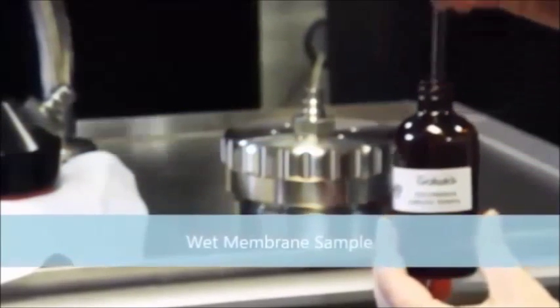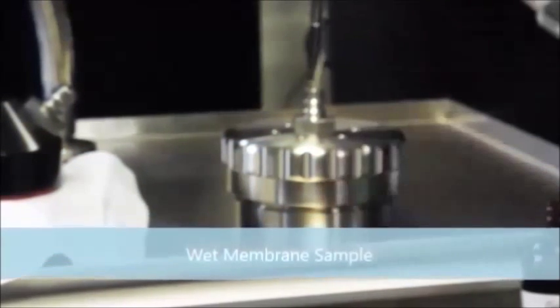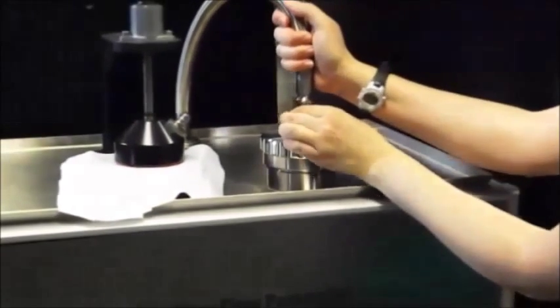This is the wetting liquid Galwick. It has a much lower surface tension than water, which means that you can test smaller pore sizes at lower pressures. This is the hose that gets attached to the top.